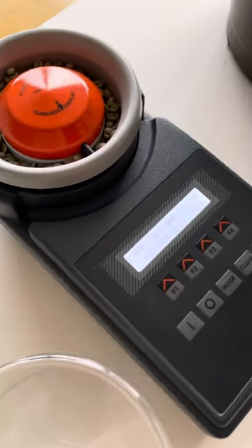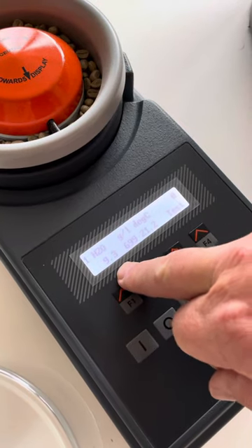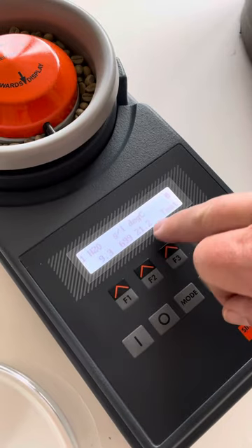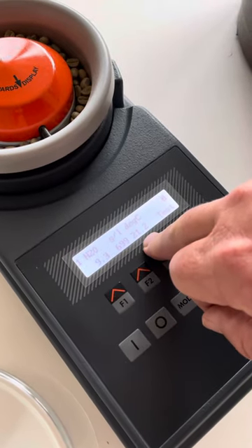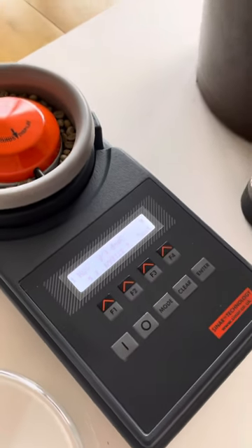This takes three seconds, and then we have the moisture content: 9.3. We have the grams per litre: 699, and we also have the temperature of the beans today: 21.2. That's it — all your readings done.